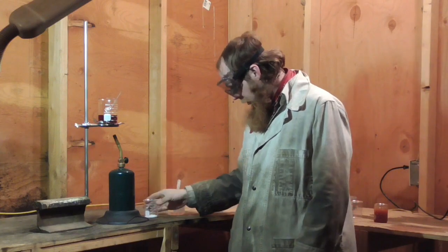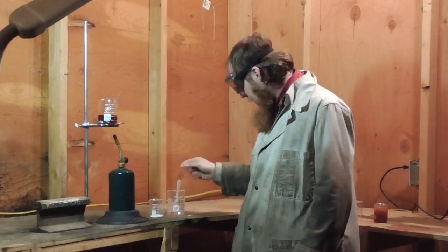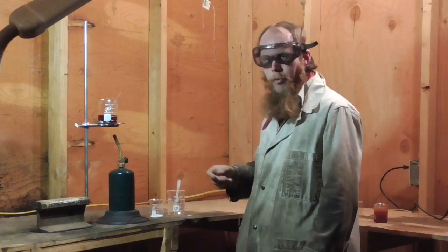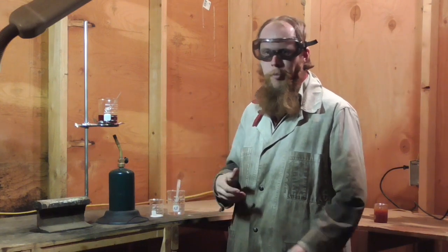I have here my sulfurized canola oil. To that, I'm going to add some sodium hydroxide, which I'm going to mix with a little bit of water to make a concentrated sodium hydroxide solution, and then we'll just heat that mixture and stir it up until it saponifies, or doesn't. Let's see what happens.